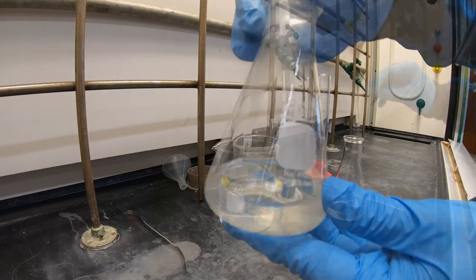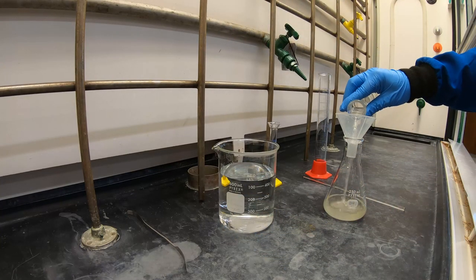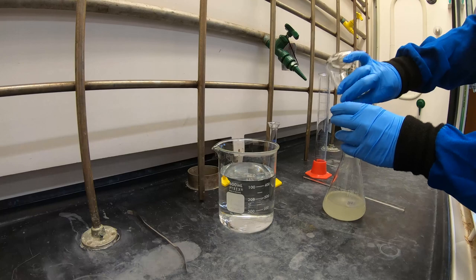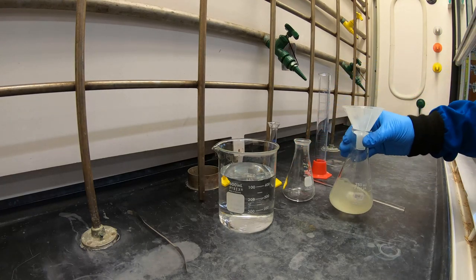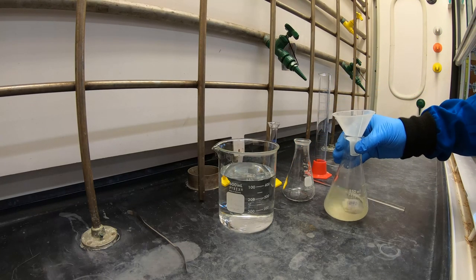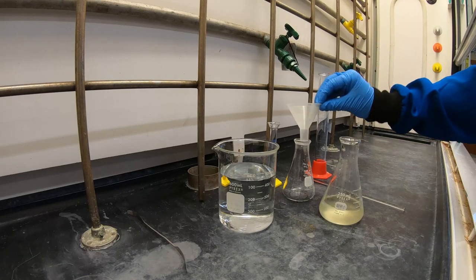Now that your tin chloride solution is dissolved, transfer it to that glacial acetic acid mixture that you just created. Swirl to combine and then let sit at room temperature for 15 minutes so that solid can crash out.